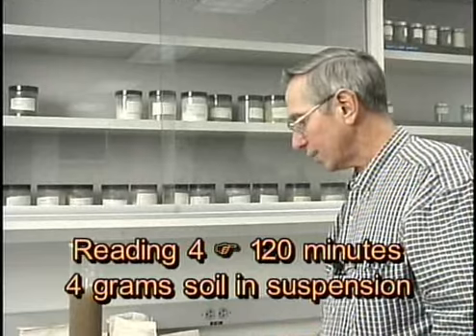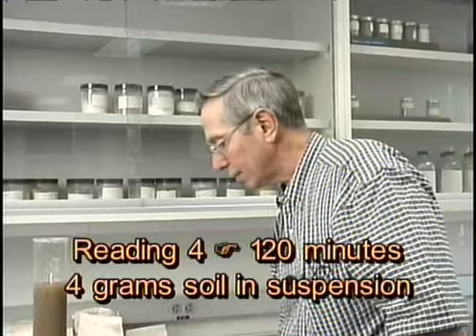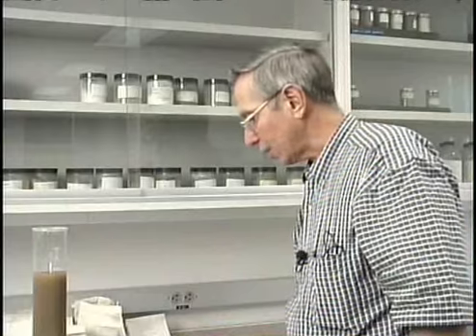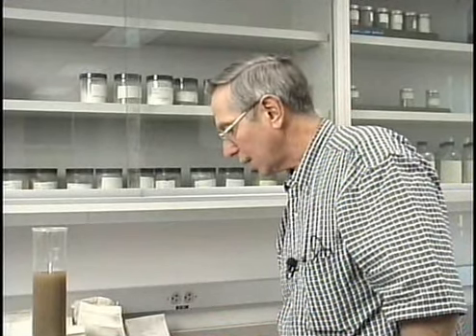So on your data sheet where it says 120-minute hydrometer reading, we would simply write in 4, the reading we got from the hydrometer. We would go to our temperature correction formula, since it's 23 degrees centigrade. Now when we look at the temperature correction formula on page 16 of the lab, or the last page of the lab handout, what we find is that this formula is telling us to take the temperature of the soil suspension and subtract 20 degrees centigrade from that. In this case, 23 minus 20 is 3 degrees.